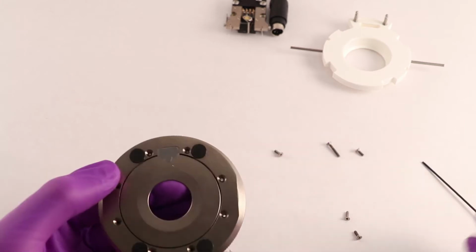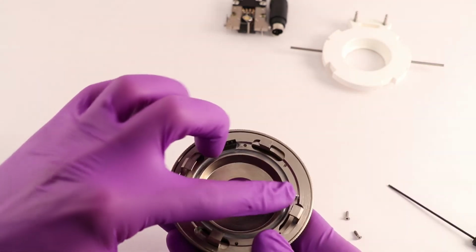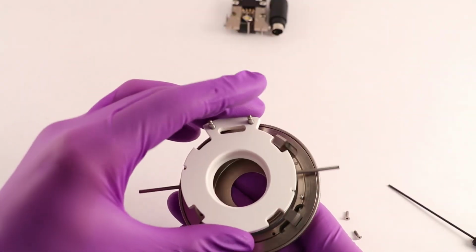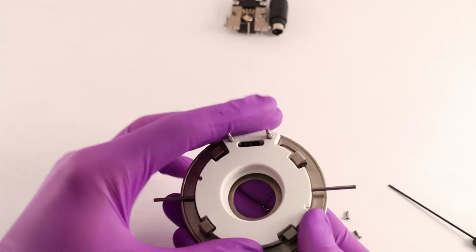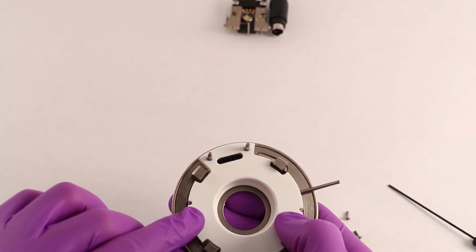Tighten the screws, making sure that at 2 o'clock and 8 o'clock the long screws are installed. These screws interface the white top and provide anti-rotation to the white top and optical stack when assembling the chamber for use on the microscope.